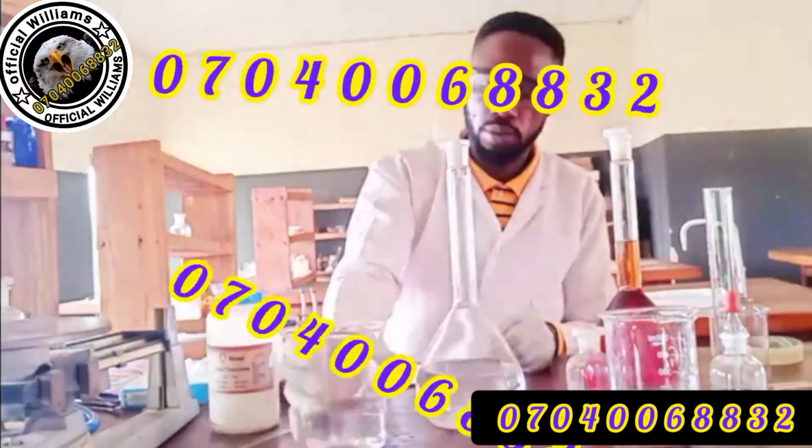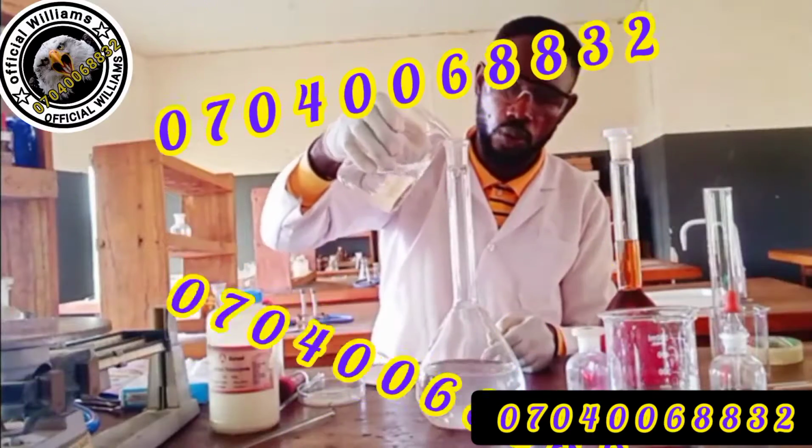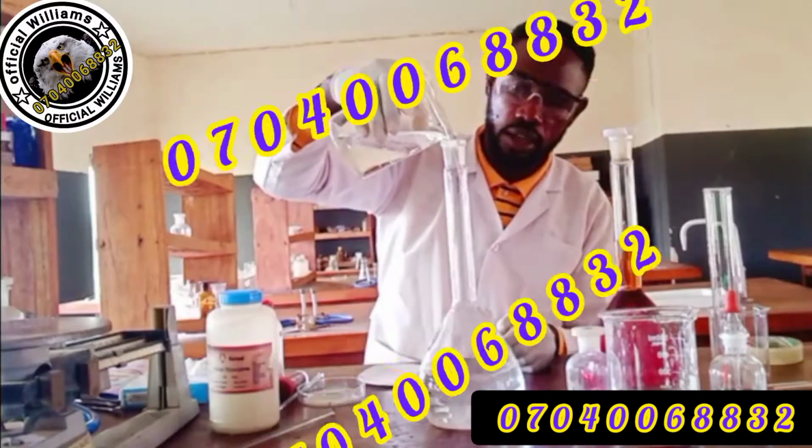Shake well. So my job now is to add up to the 1000 cm cube mark.